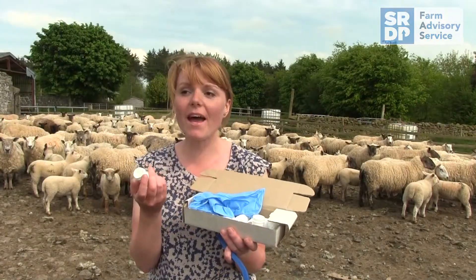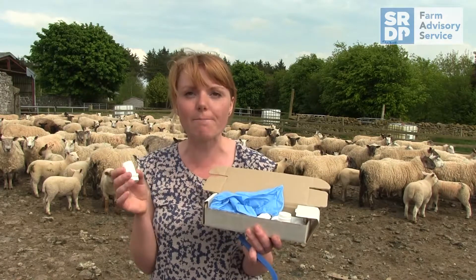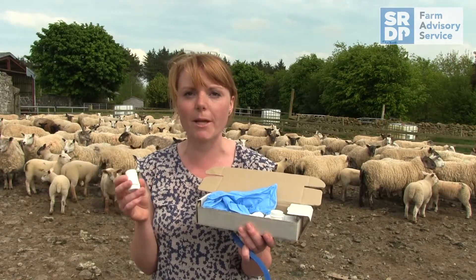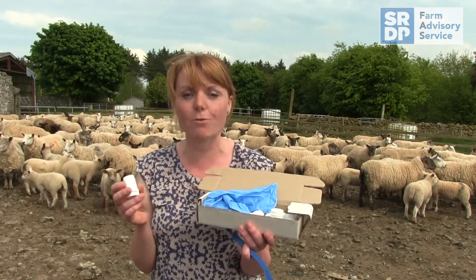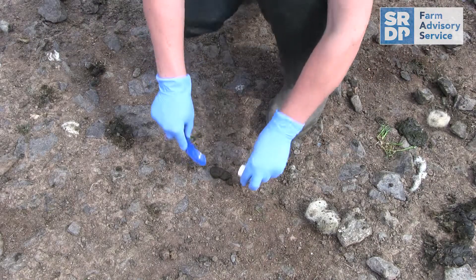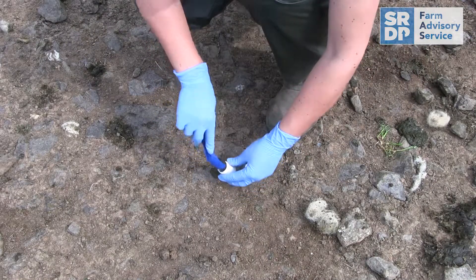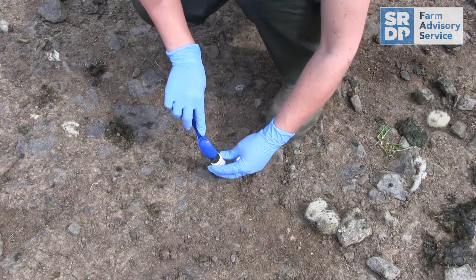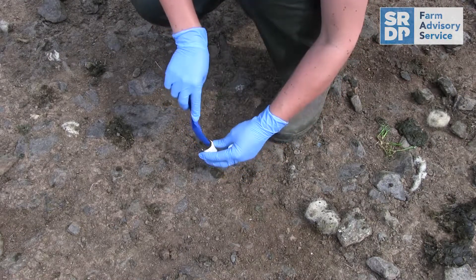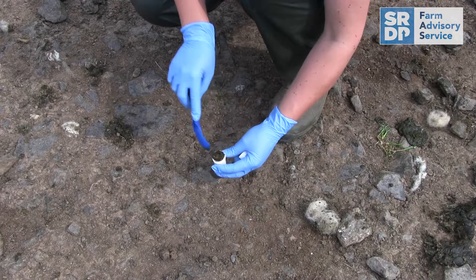It's important that the samples are taken from a consistent batch of animals — so similar age, similar management — to be informative. Make sure the sides of the pots are clean before you send them away, and that they're sealed well. Try to get them sent off to the lab immediately after sampling to reduce any hatching risk.